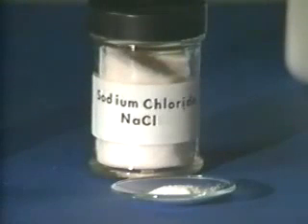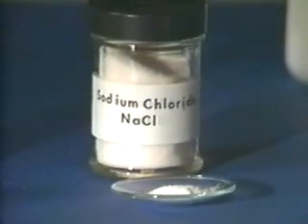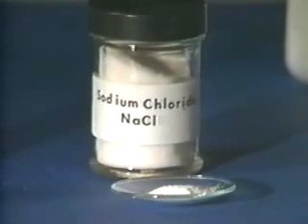Next, sodium chloride. Sodium chloride is placed on the platinum wire. It gives a characteristic yellow color when placed in the Bunsen flame.